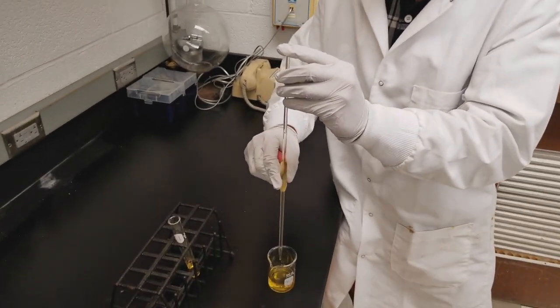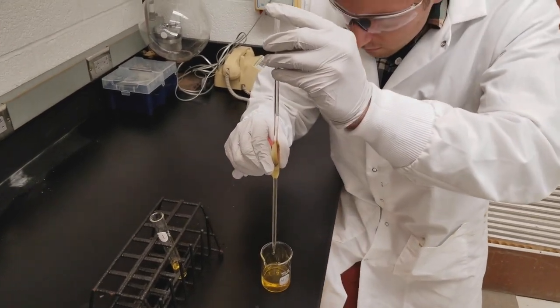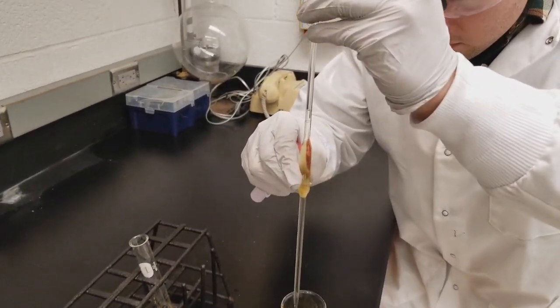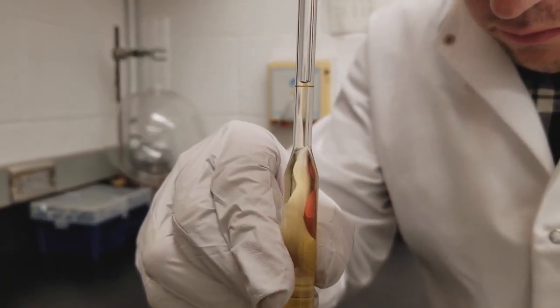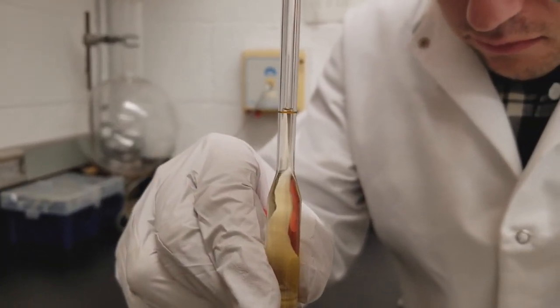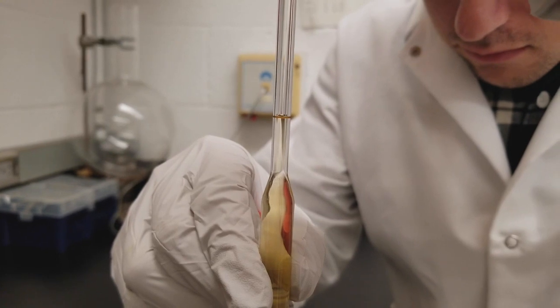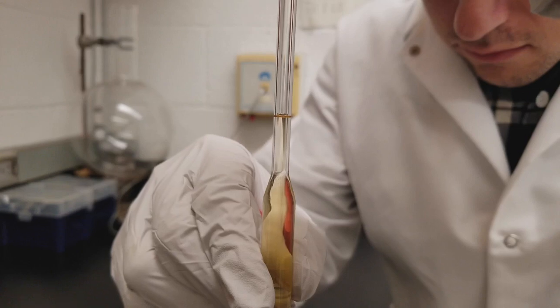Remove the bulb and put your finger on the top to create a seal. Now wiggle that finger on top of the pipette until the bottom of the meniscus just reaches the line designated on the pipette. It's really important that the bottom of the meniscus is right at that line. We can't estimate with these pipettes.